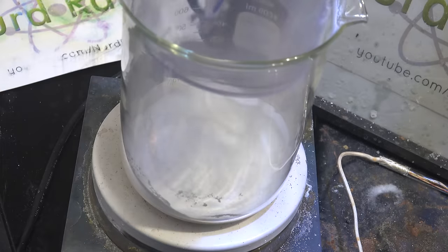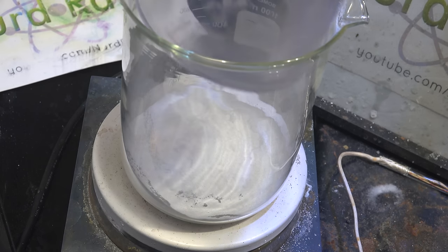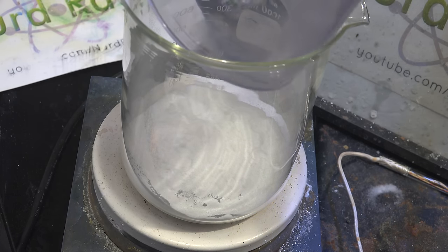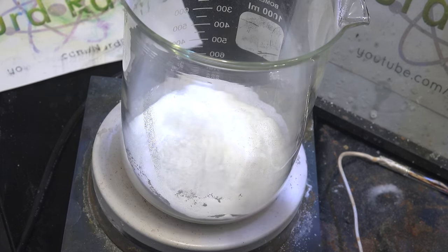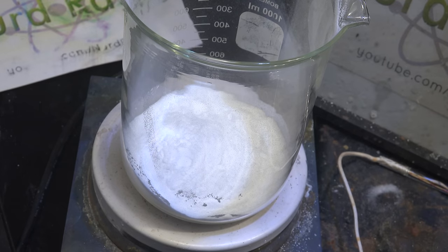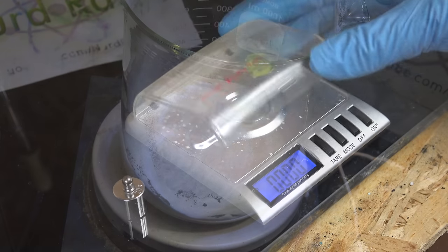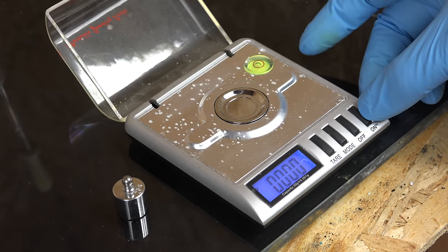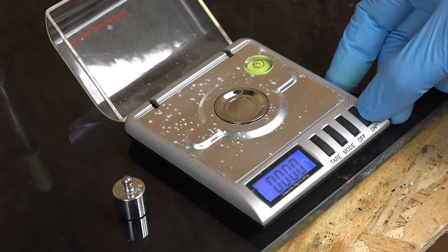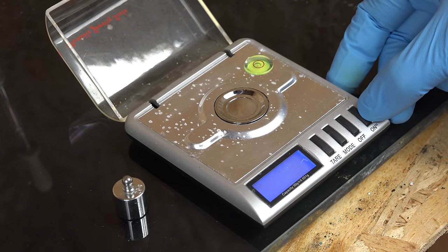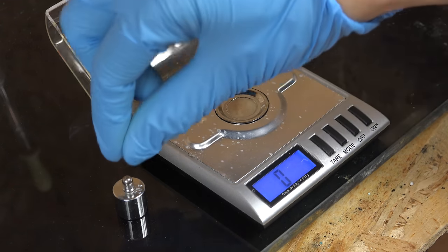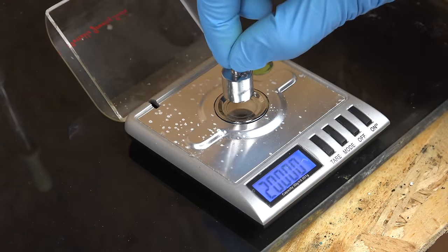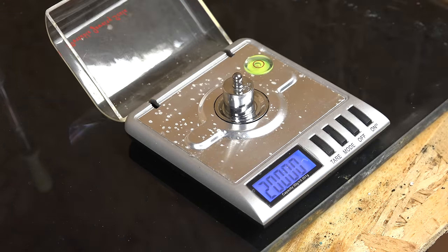So let's do that with sodium oxalate. Before we begin make sure your sodium oxalate is dry. If you're unsure heat in an oven to 200 celsius for an hour or store it in a desiccator for a few days. It needs to be dry. We get a milligram scale and we calibrate it using a standard calibration weight. Every scale is different and you'll have to follow the instructions for your particular scale.